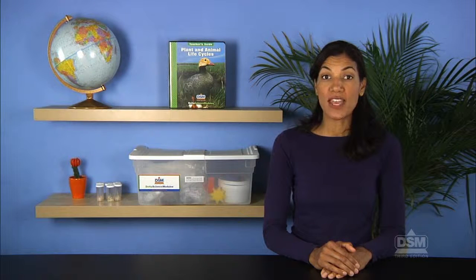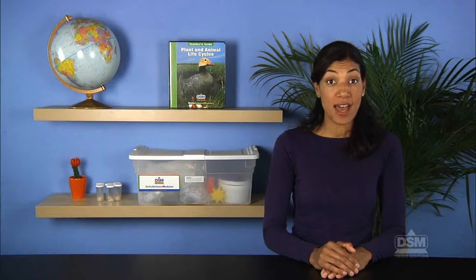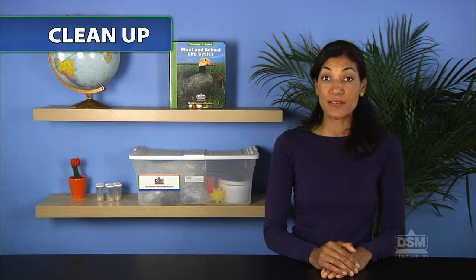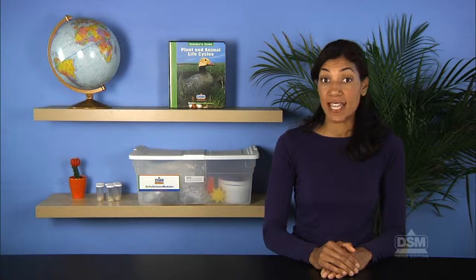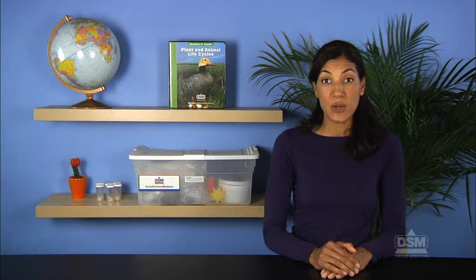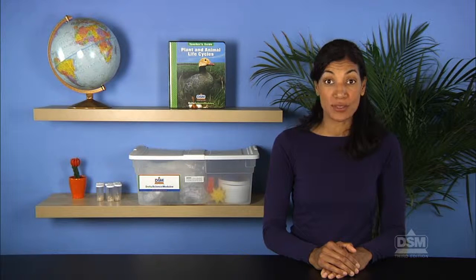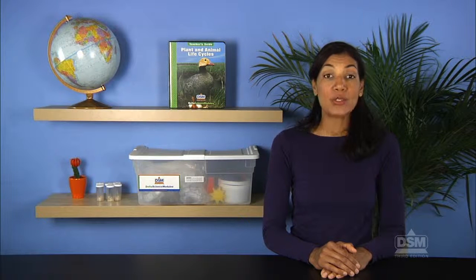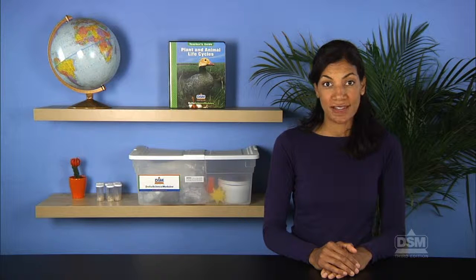Finally, inform students that they will have more opportunities to observe changes in their fruit flies in Activity 5, Observing the Fruit Fly. To conclude the activity, have students place their vials together in a safe place out of direct sunlight where they can freely observe their fruit flies without disturbing the vials of other students. Return the masking tape to the kit and place the magnifiers and file folders with the vials in this designated area. Make sure to hold on to the pictures showing other life cycle stages for use during future activities.